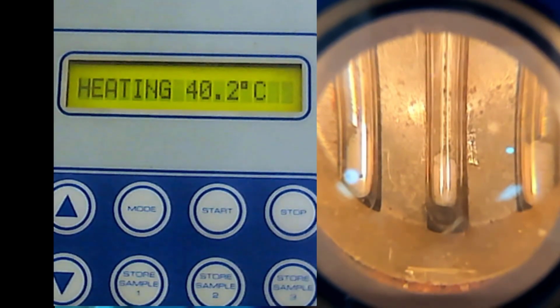And you need to understand, when you heat something and then cool it down, the cooling happens not forced, meaning that it will cool slowly. The students need to wait until it's cool enough in order to start the next mixture melting point experiment.